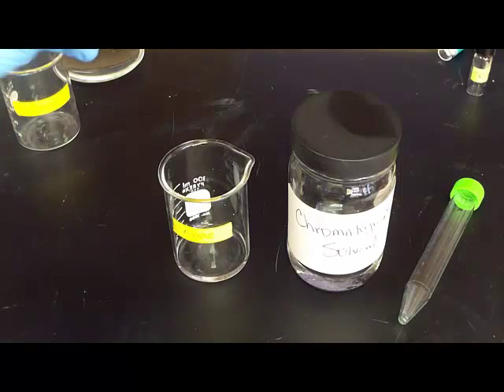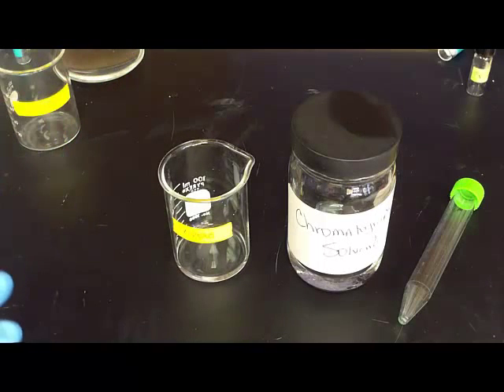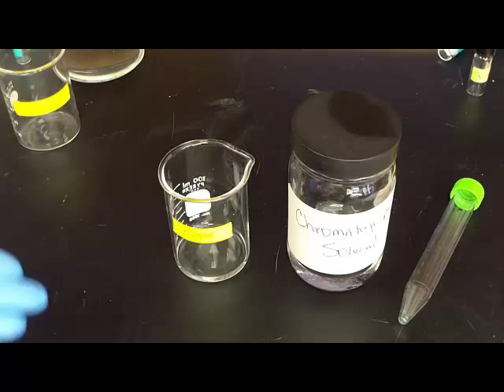It looks like you won't have much in the bottom of the beaker but the plates are small and we want it to absorb up and separate the pigments. So that's kind of the big supplies. Of course you'll have a more detailed list when you're actually doing the lab.